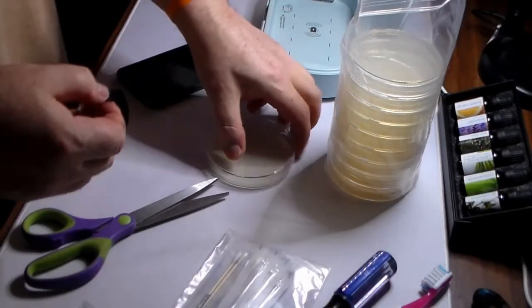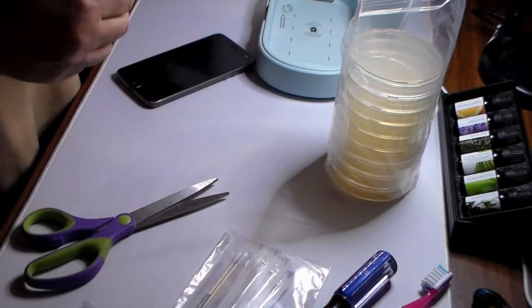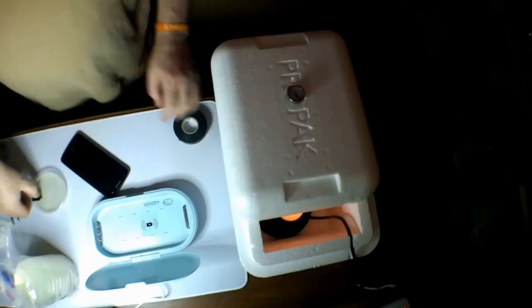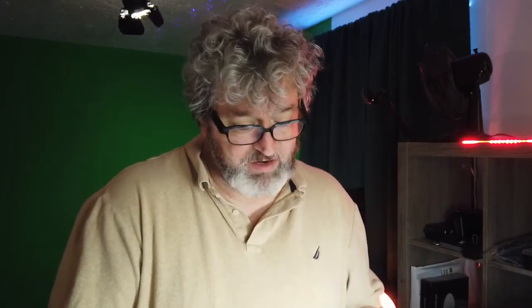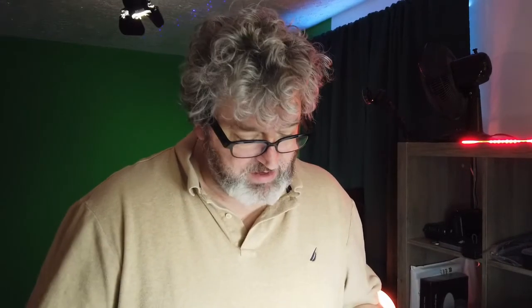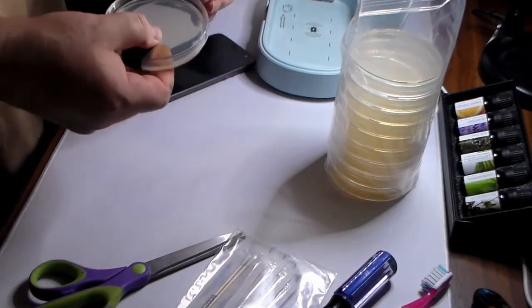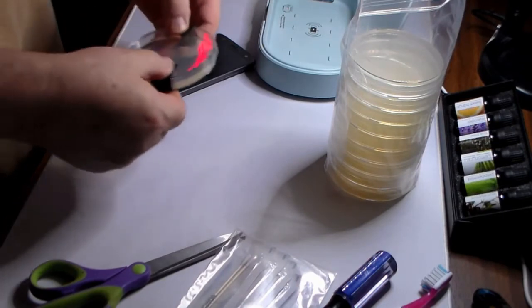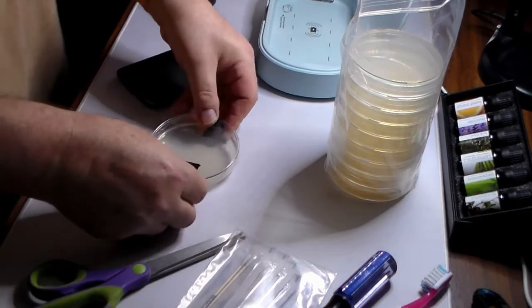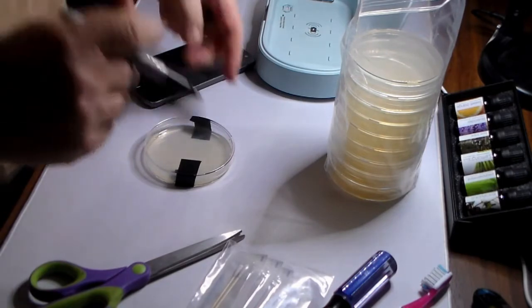Now the incubator, I have been able to calibrate to run at just short of 100 degrees. All the instructions I've read said not to exceed 100 degrees. And I will be honest, I would rather it even go down to as low as 70 degrees if it had to, rather than exceed 100 degrees. So I will calibrate this and keep this to the low side, but I will try to keep it around 95 degrees. Okay, I have a sealed petri dish. We're going to label this cell phone 1, so we'll call it C1.